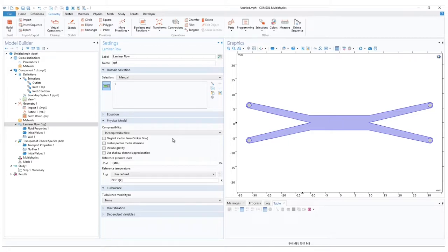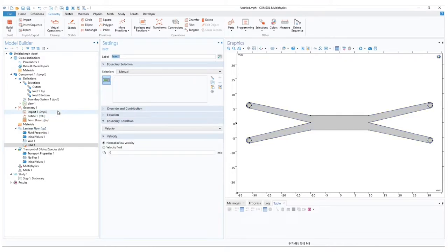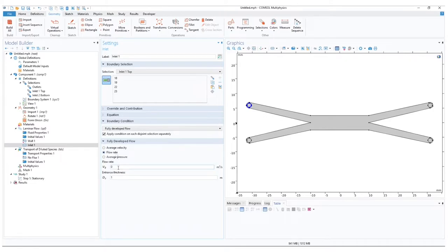In the Model Builder ribbon, right click on Laminar Flow and add Inlet. To select our boundaries that would represent this inlet, in the boundary selection, choose Inlet Top. After this, we specify the conditions at these inlet boundaries. Choose fully developed flow. And instead of average velocity, select flow rate. And for the flow rate, set the global variable V in.